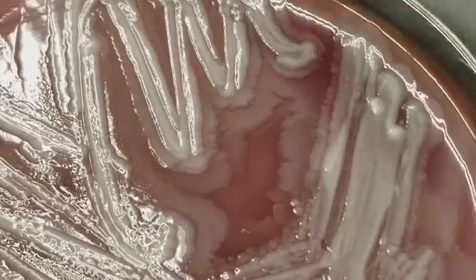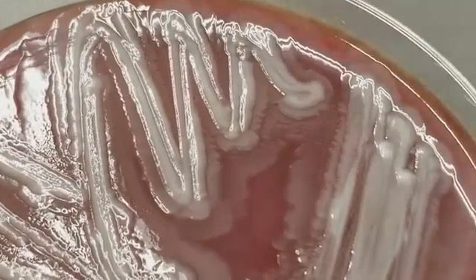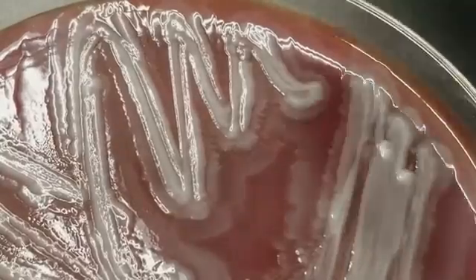And they also are rapid growers. They divide very quickly. This is just gorgeous. I don't really want to take this off, but we've got to move on. So this obviously would take over the plate and just eat its way around the plate, and you could definitely tell that was a pathogen there. All right, this one is from a sputum.